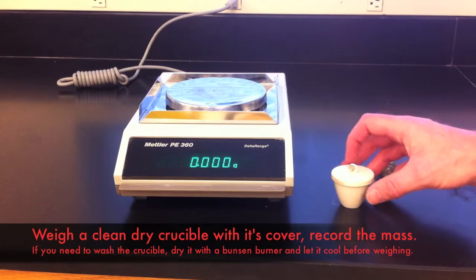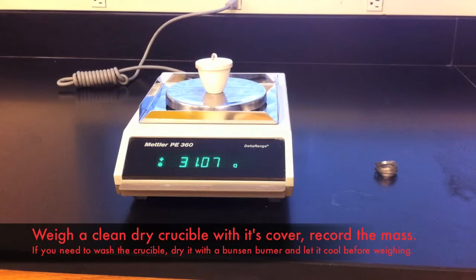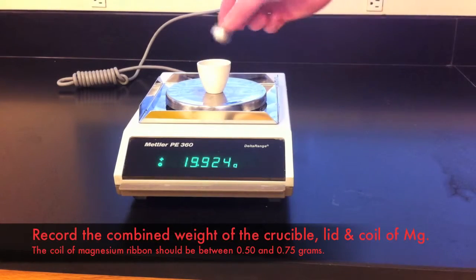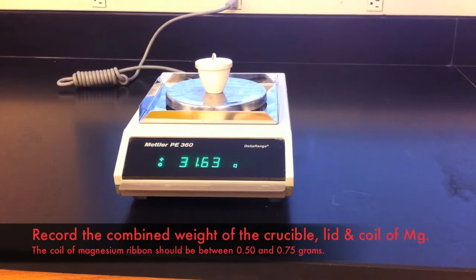To begin, you will need to determine the mass of a crucible and its lid. Make sure they are both clean and dry before you weigh them. Once you have recorded the weight of the crucible and the lid, add in the magnesium ribbon and record the combined weight. The weight of the ribbon should be about 0.5 to 0.75 grams.